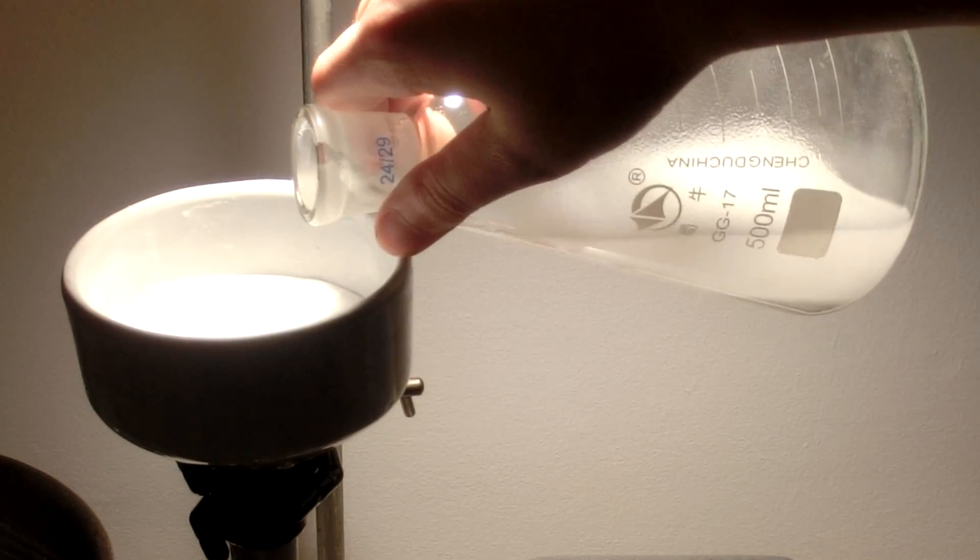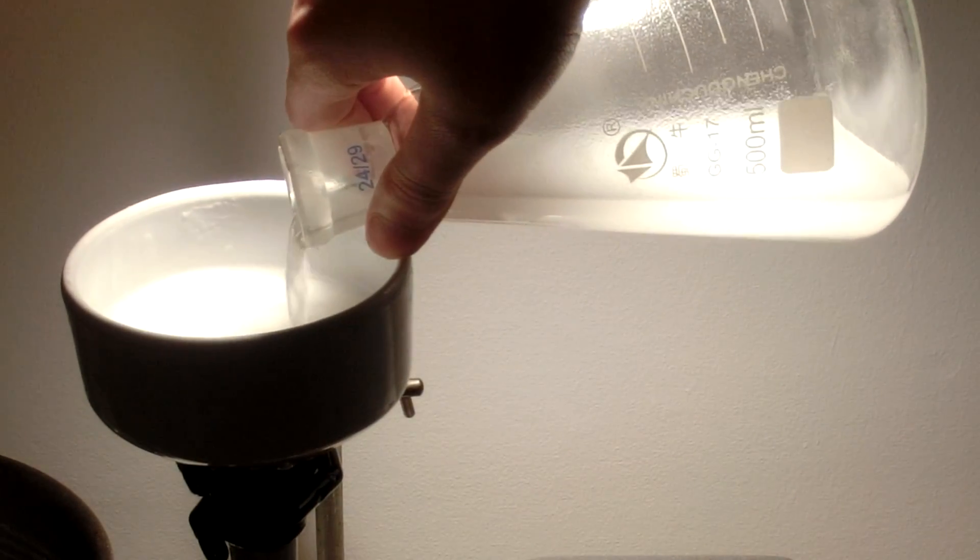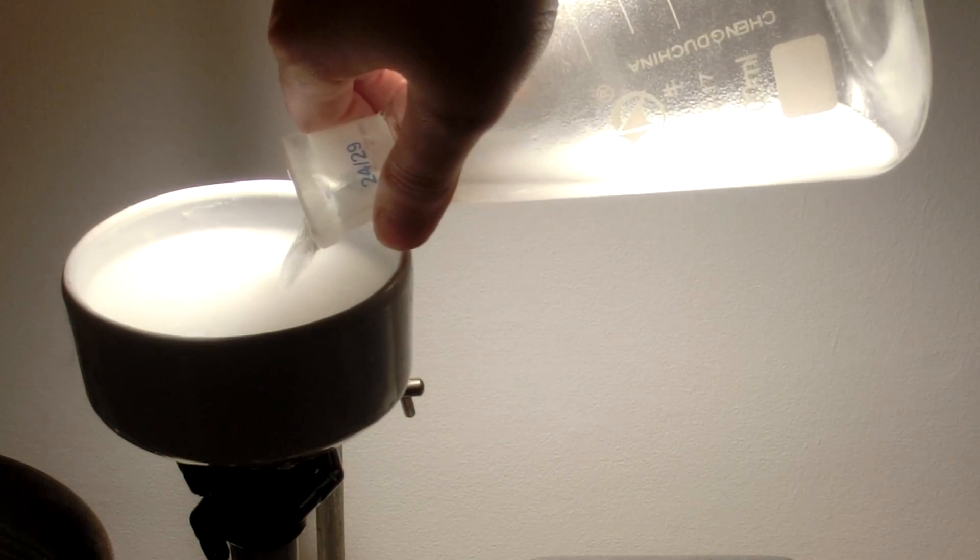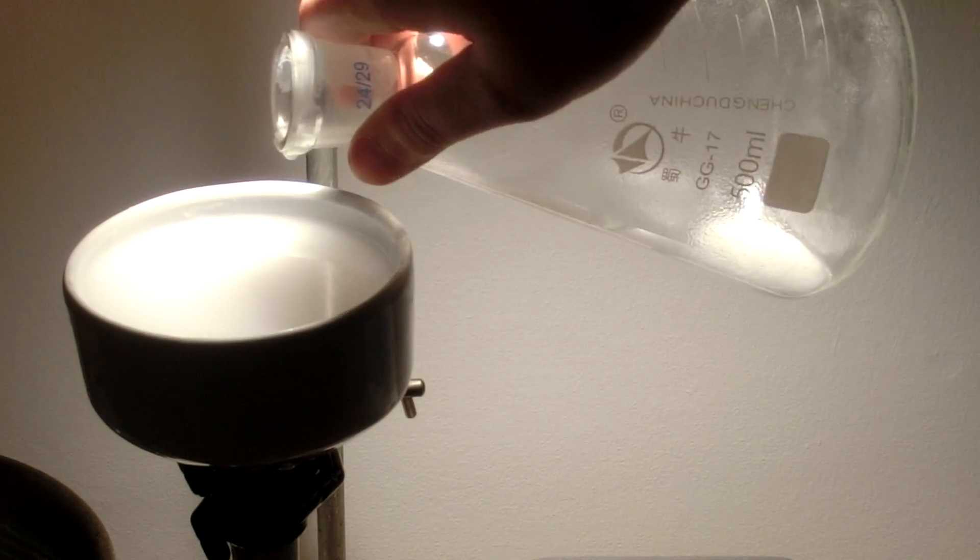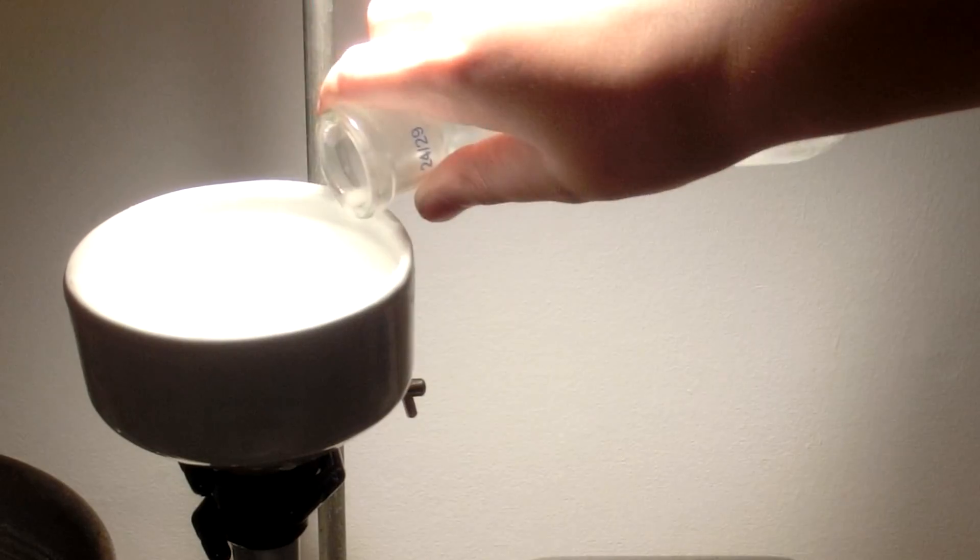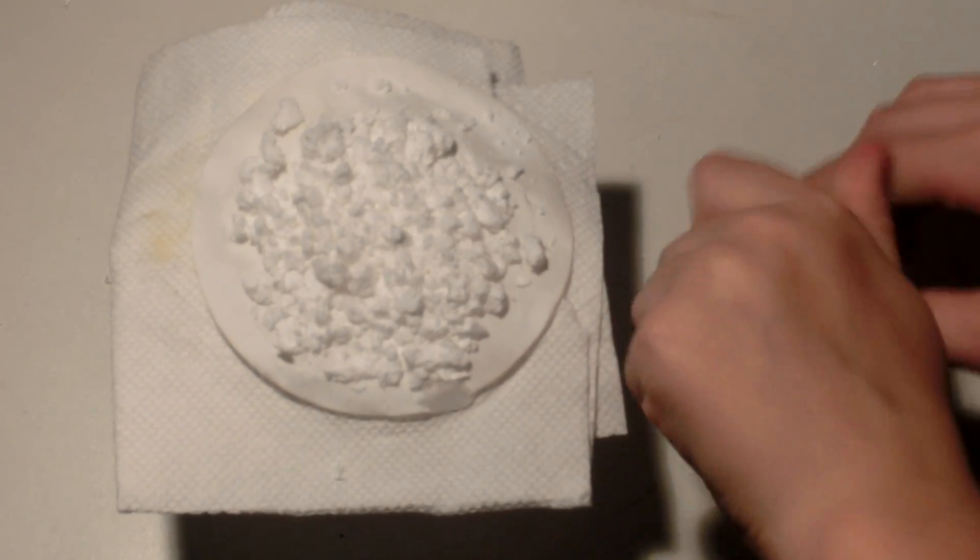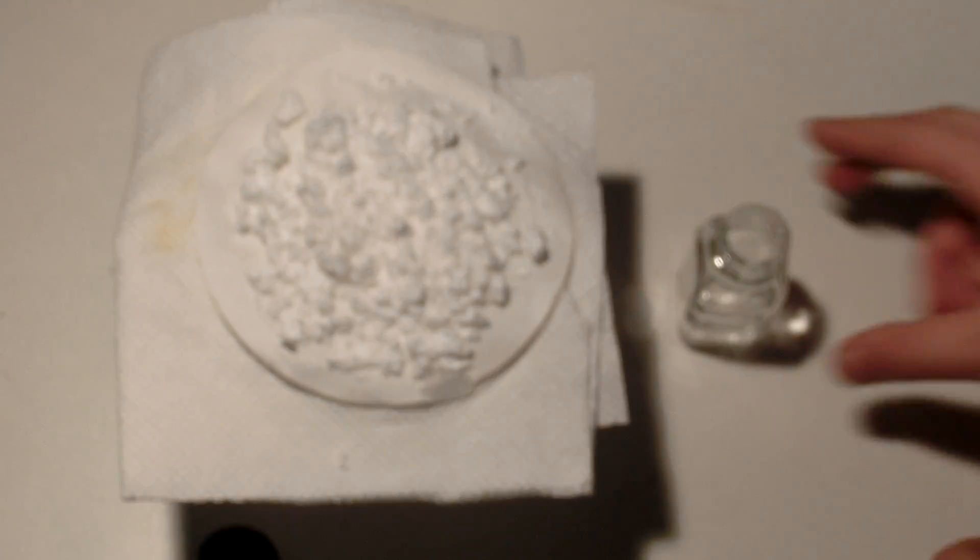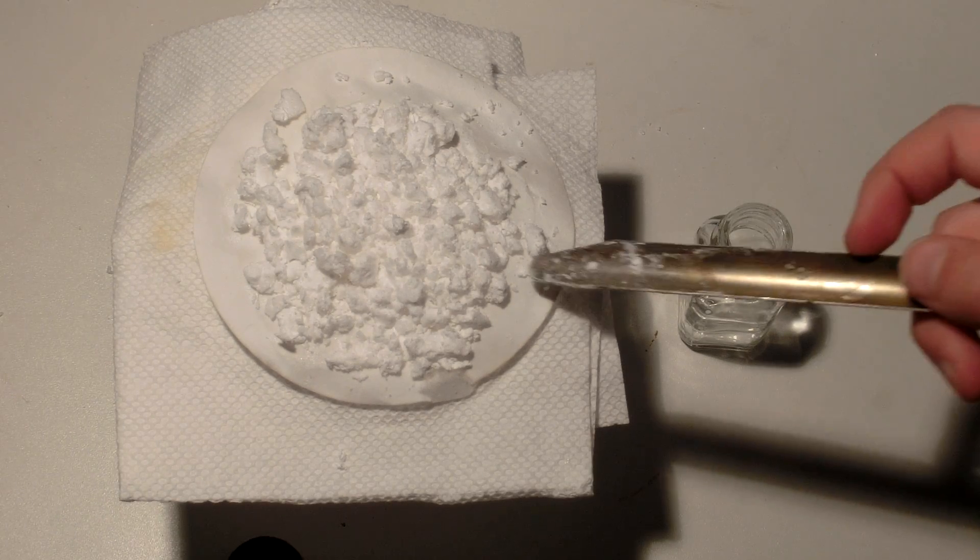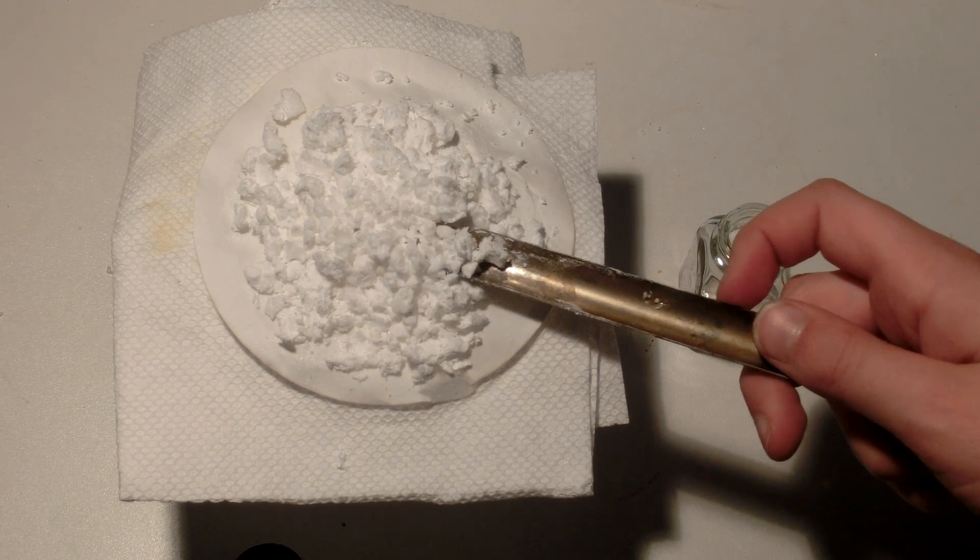This should then be filtered to collect the acetylsalicylic acid. After drying, you will be left with a white fluffy powder. This should then be transferred into an airtight bottle for storage.